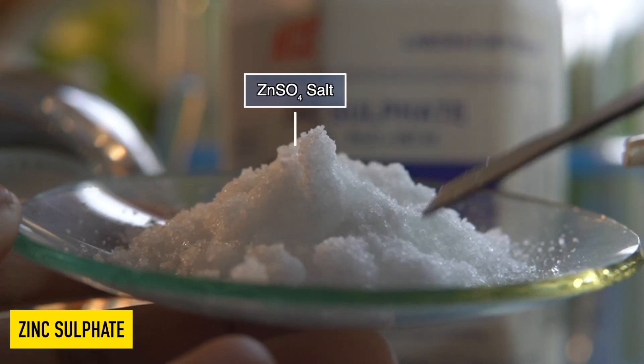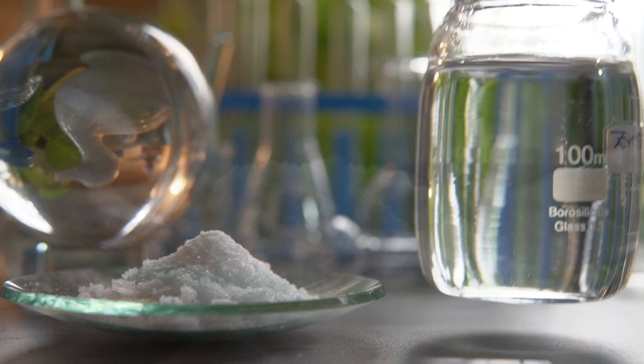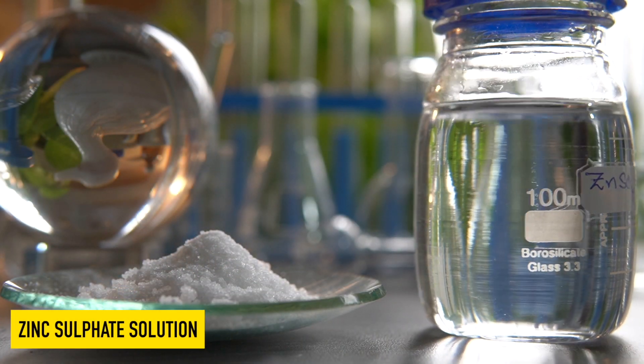This is zinc sulfate, a white crystalline solid and it's highly soluble in water.